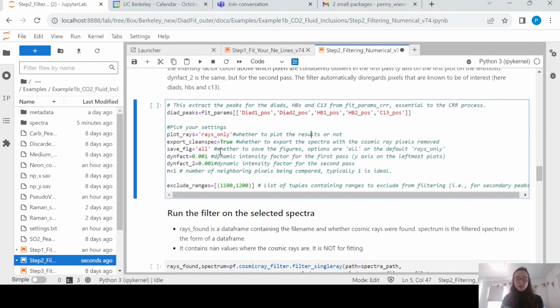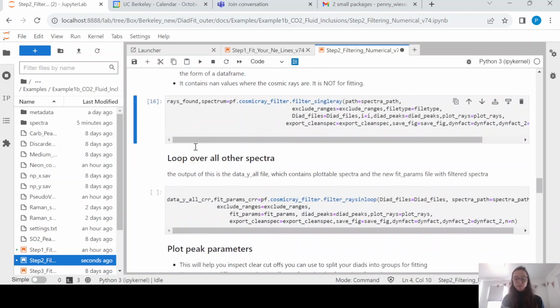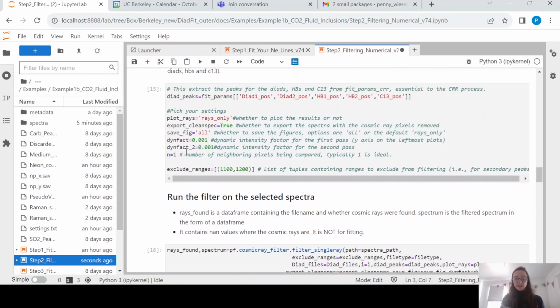So what this is doing is basically just some things that you can adapt. You can say a range where you don't want to remove cosmic rays. A reason we've done this is the SO2 peaks are extremely sharp and the algorithm can often remove them thinking they're cosmic rays. So these are basically the two things you're going to adjust depending on the intensity of your Spectra. And here we're saying that we're just going to save some figures showing how we've subtracted the cosmic rays. Okay, so let's run this filter and then have a look.